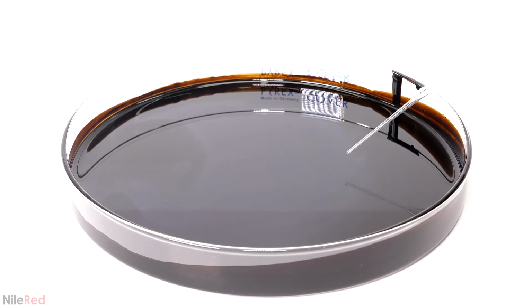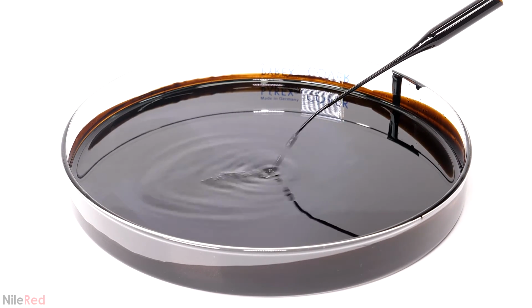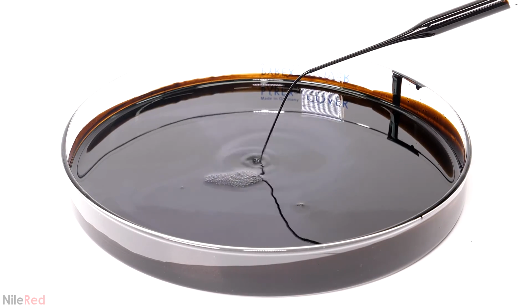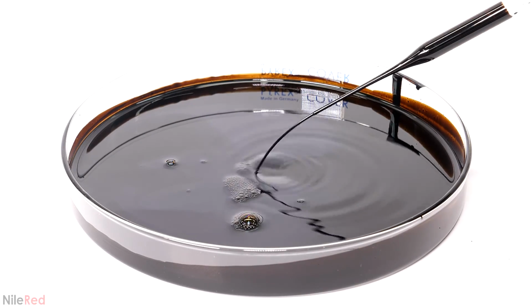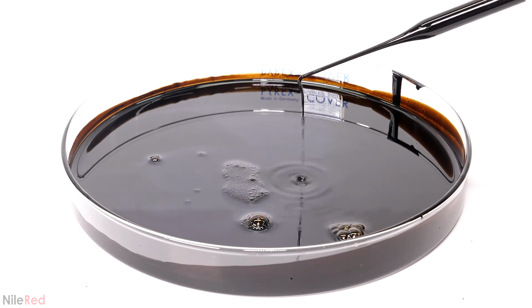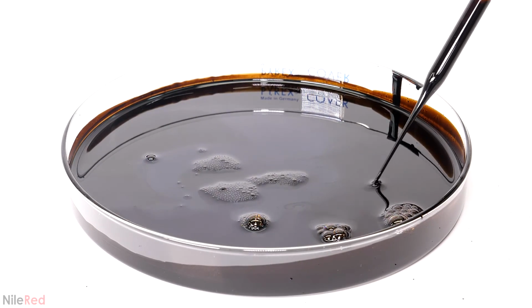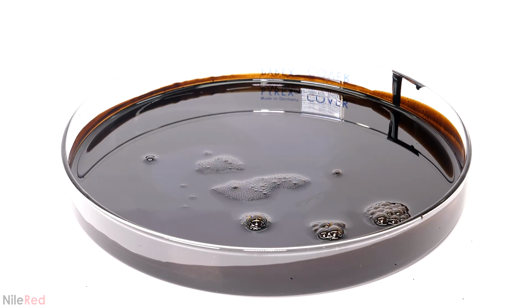At this point, I was pretty much done playing around with it, but I just wanted to show one last thing. I mentioned before that it didn't get more viscous under a magnetic field, but in general, it just wasn't very viscous at all. It was pretty much the same as just regular kerosene, despite being about half magnetite. From all the runs that I've done, I've noticed that the viscosity is actually something really important to look at, and every time that it's been thicker, it's been a really bad sign.